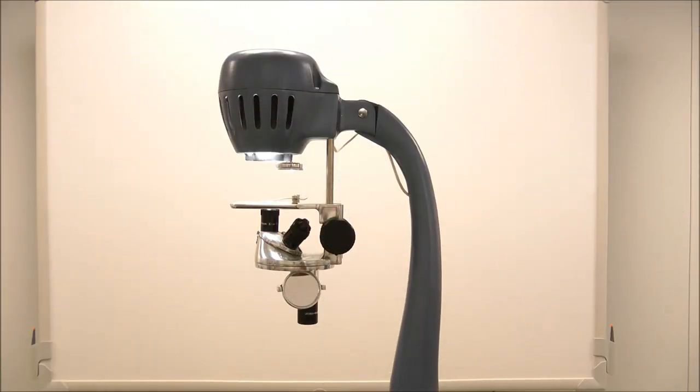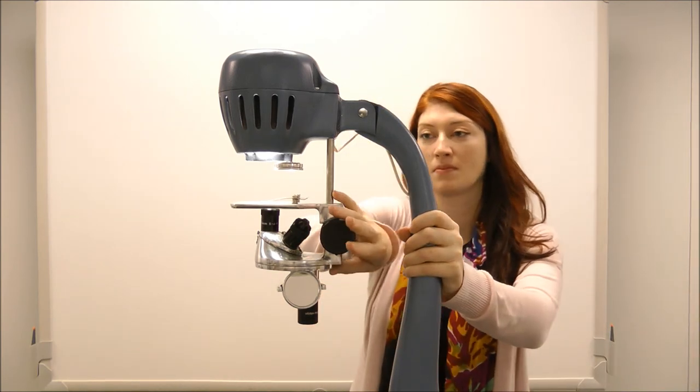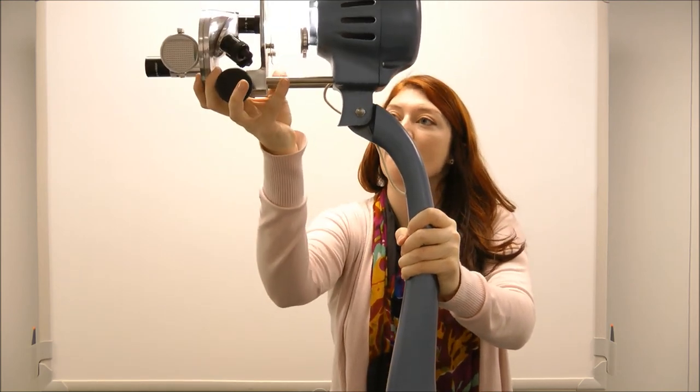For screen or direct projection, the room may need to be darker for this to be seen. Carefully, you are going to rotate the entire head of the unit into a horizontal position.